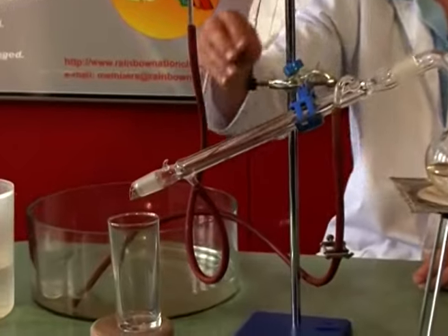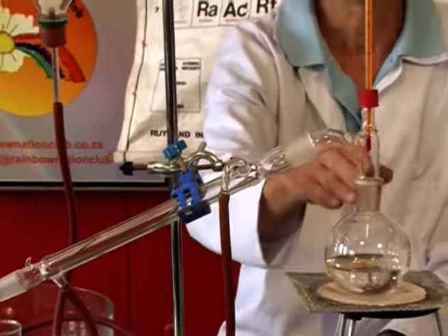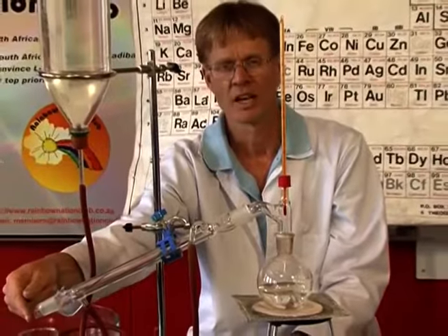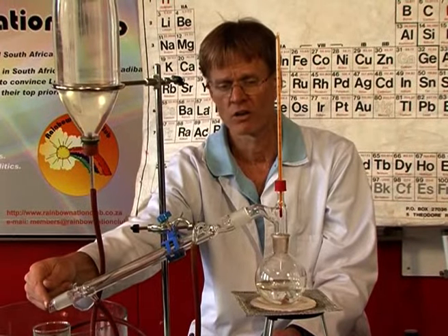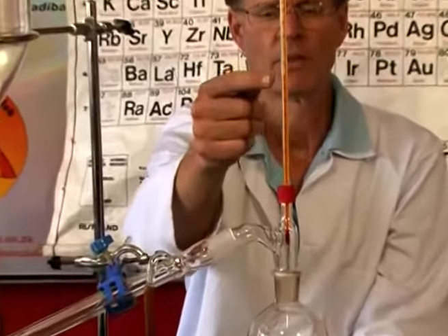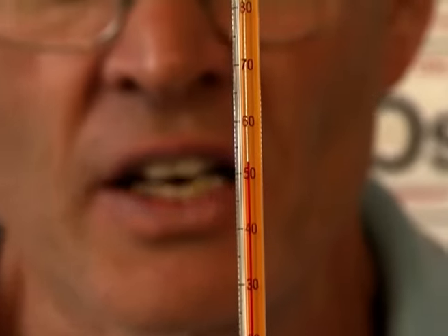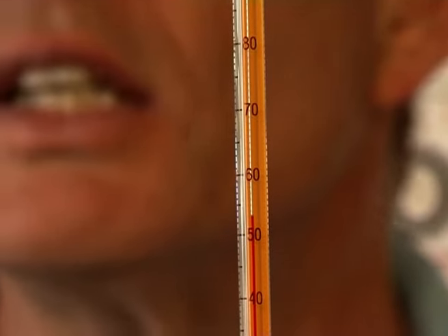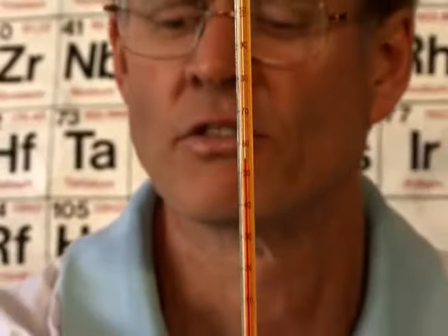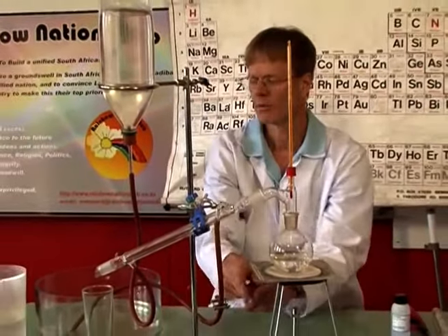So this creates a jacket of cold water around the inside of the tube. So any of the vapors coming through this side will condense and run down that tube, and we'll be able to collect a much purer form of alcohol on that side. The other thing to keep an eye on is the thermometer. When it gets to about 70, 72 degrees, then we know that it is the alcohol that is coming off. I'm going to have to keep an eye on that. I can slow it down for now until it starts boiling. And I'll have to top it up now and again.